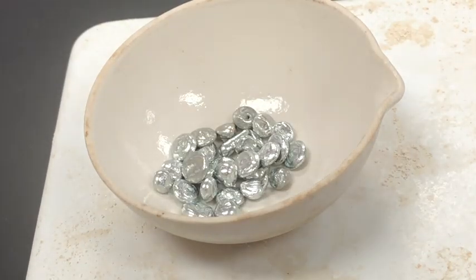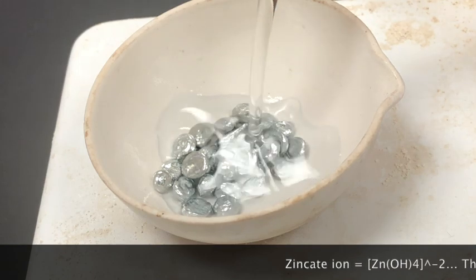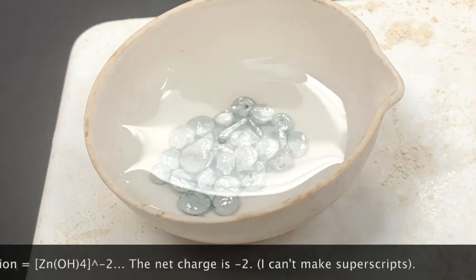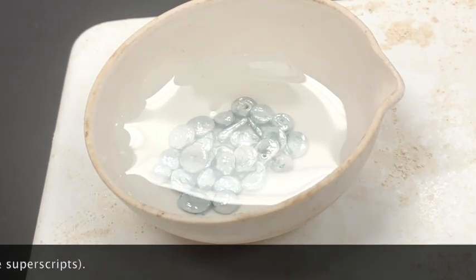While the hot plate is heating, add the zinc to the evaporating dish and pour into it the sodium hydroxide solution. The high concentration of the sodium hydroxide solution and the heat turns the zinc metal into an ion called zincate. The formula is in the ticker below.